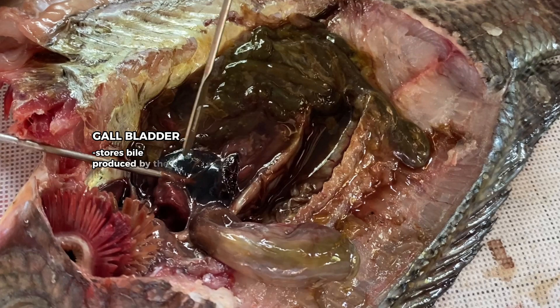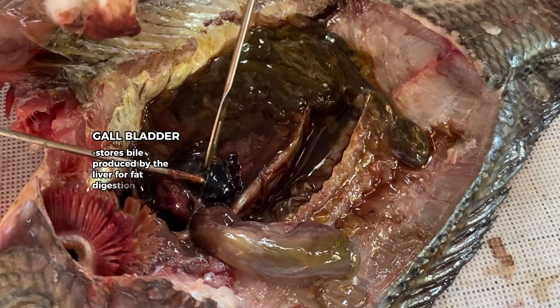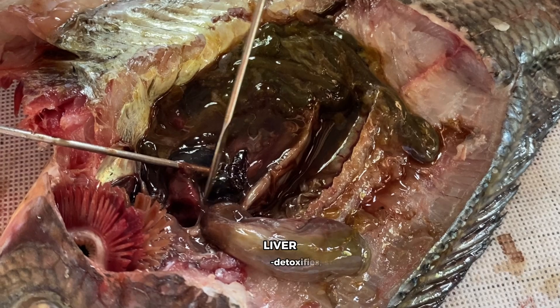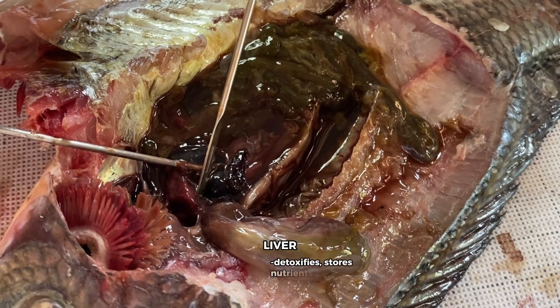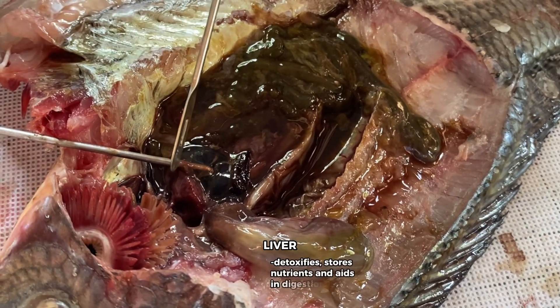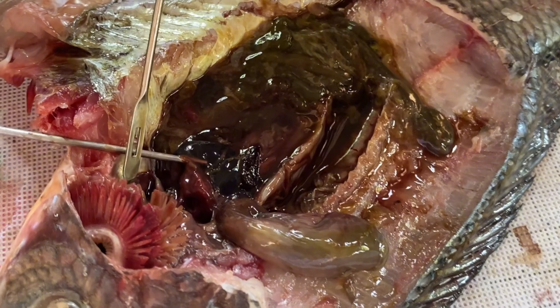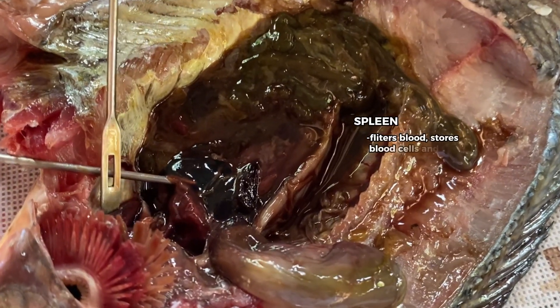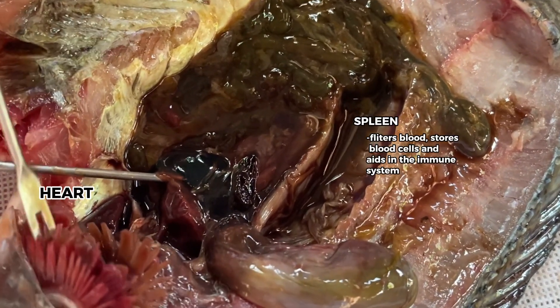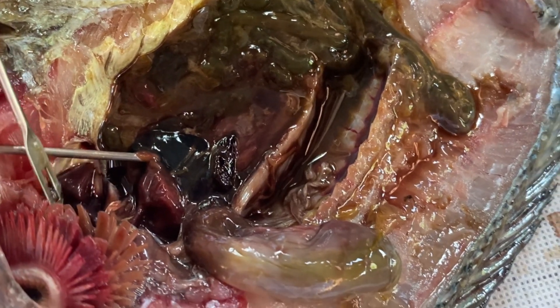Gallbladder: it stores bile produced by the liver for fat digestion. Liver: it detoxifies, stores nutrients, and aids in digestion. Spleen: it filters blood, stores blood cells, and aids in the immune system.